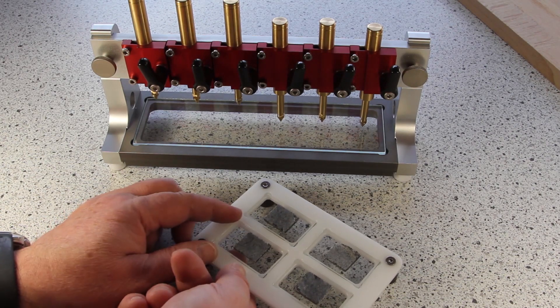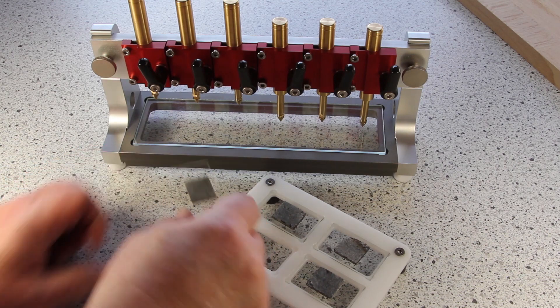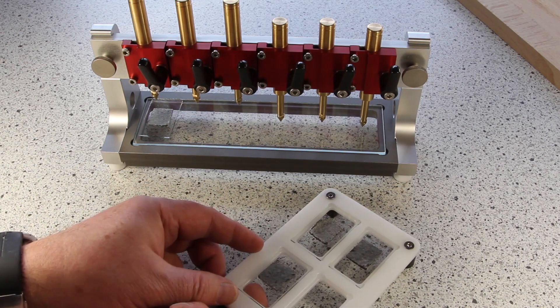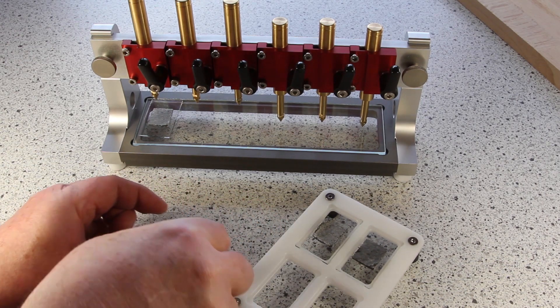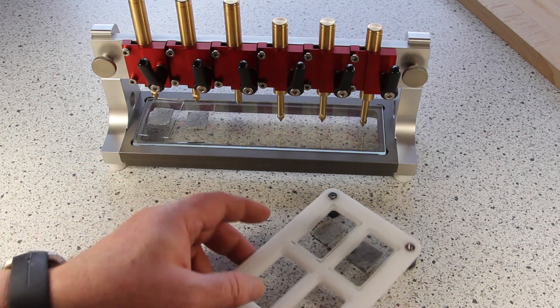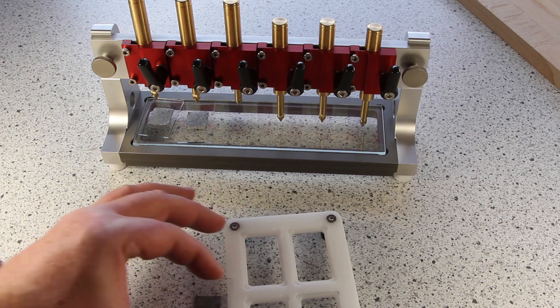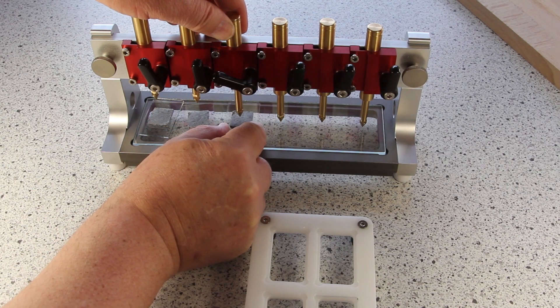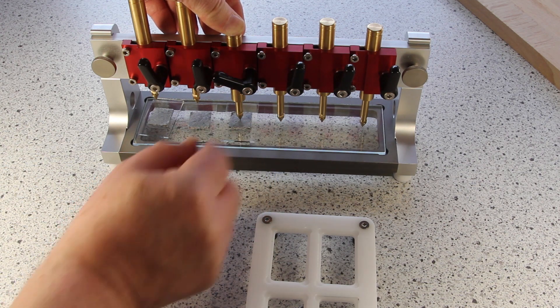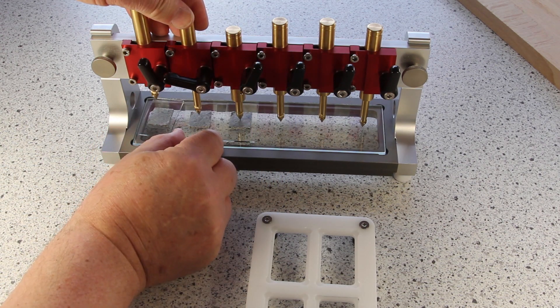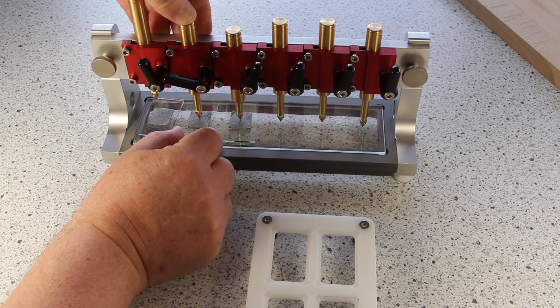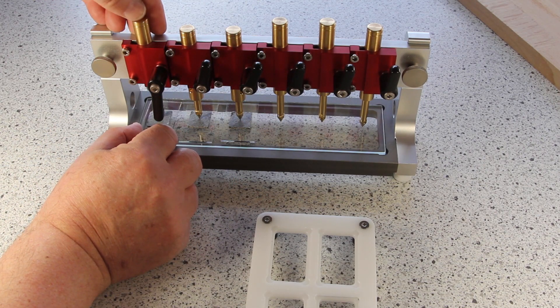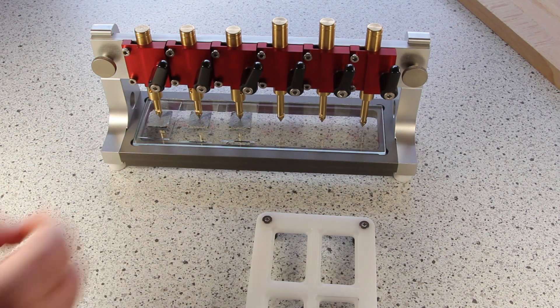And now I put on each place one of the samples. I let down the holder. I press it down. I make sure that it pulls into the middle of the sample. And then I close it.